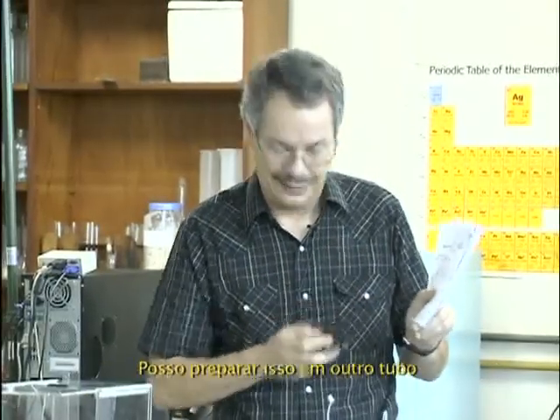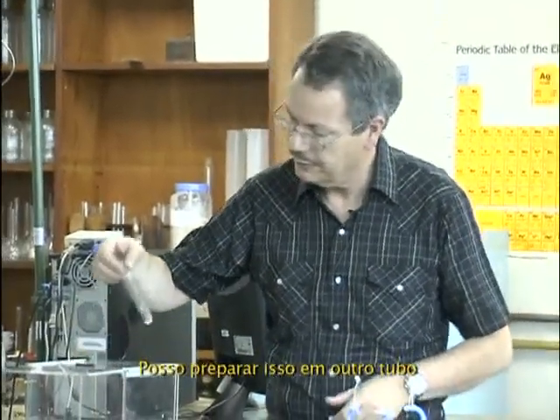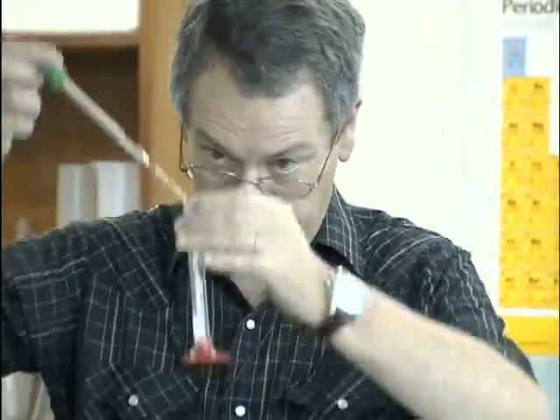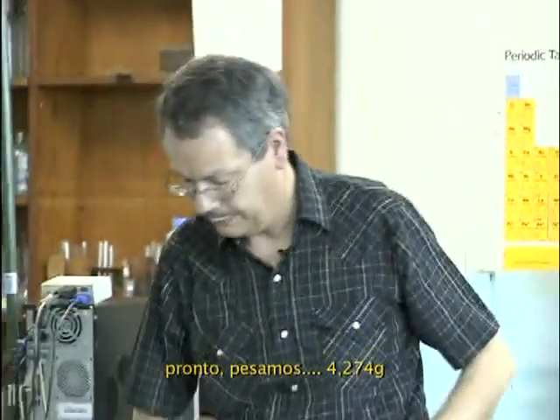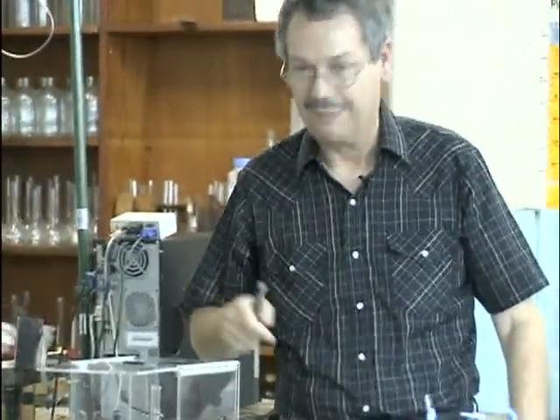But still, I can prepare this in another tube, 4 mils of water. I'll adjust it exactly to 4 mils. Where is my water? This and this. There. And weigh it. It's 4.274.